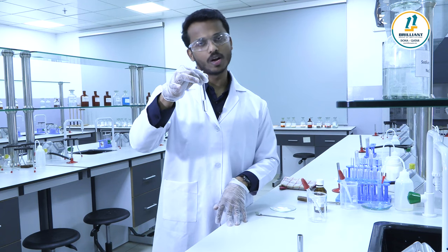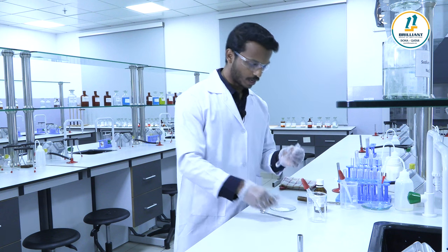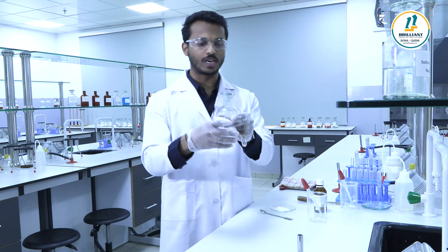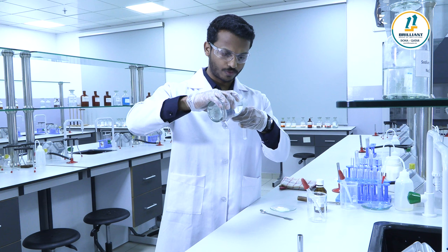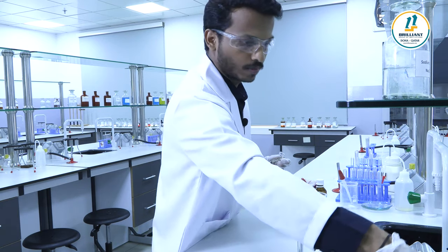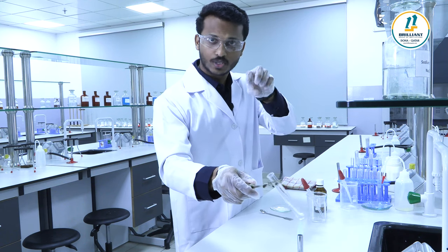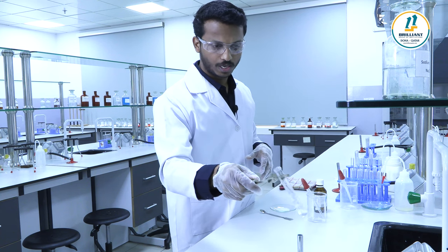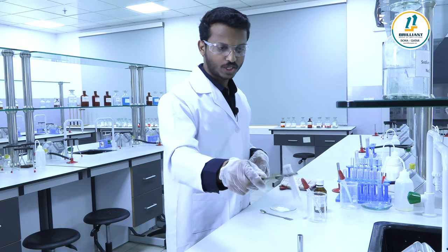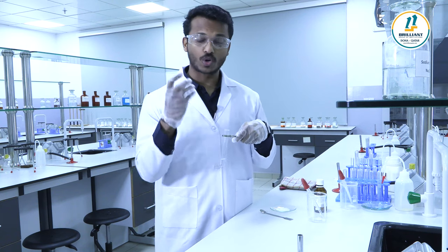Now let's go for the confirmatory test for ammonium cation. Take a pinch of salt into a test tube. Add sodium hydroxide solution and warm gently. The mixture will have a very strong smell — that is ammonia.